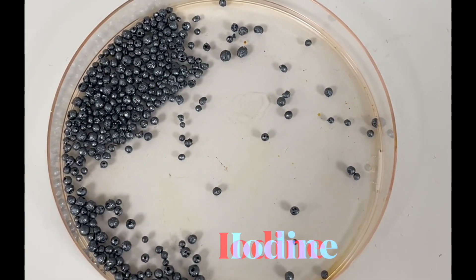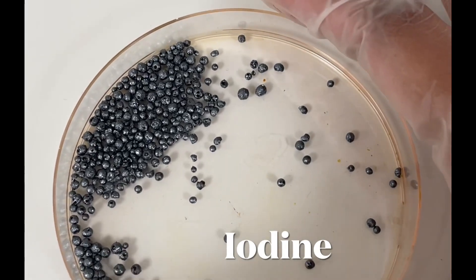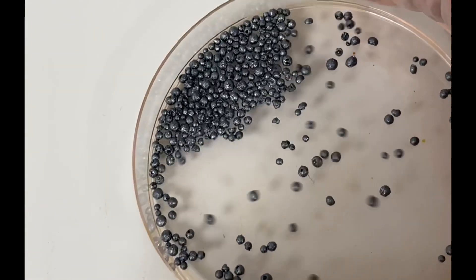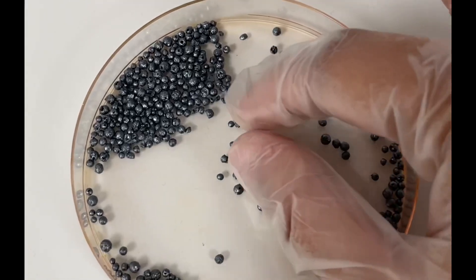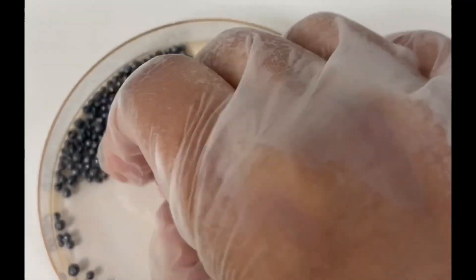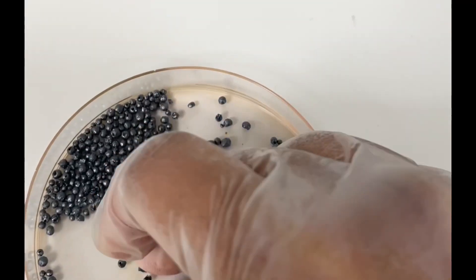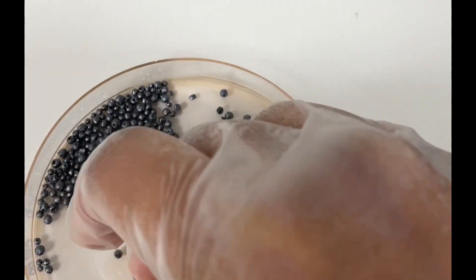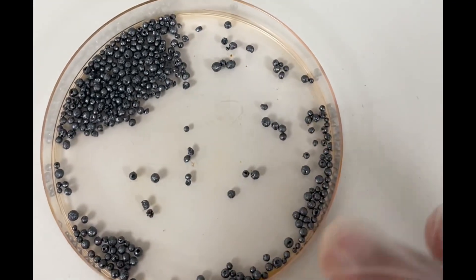Before we start, I would like to show you how iodine looks. These are iodine balls and they stain your hands and your dress — it's brownish in color. That's why it's important to wear gloves while handling iodine.